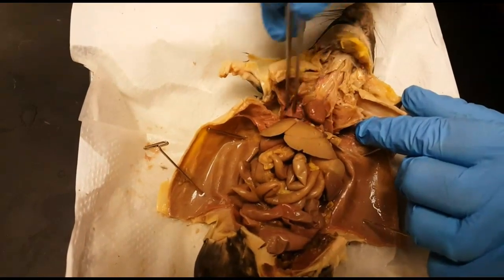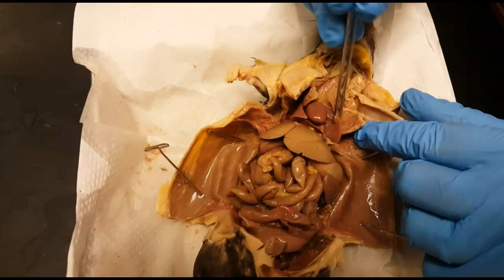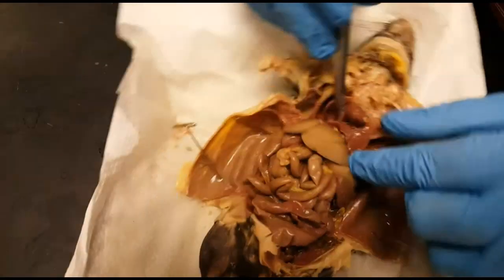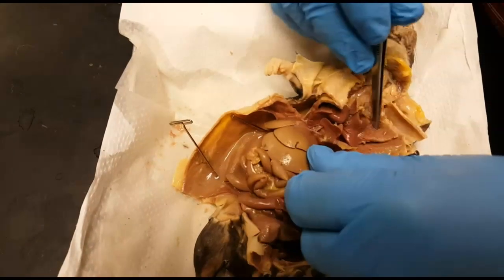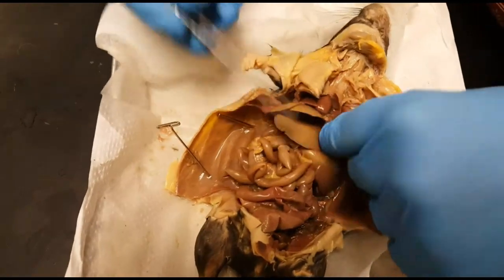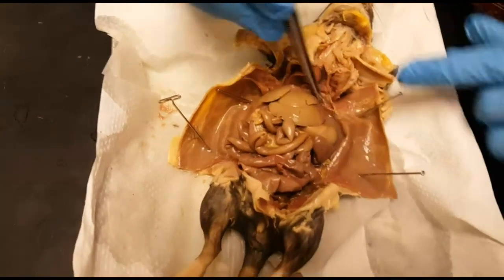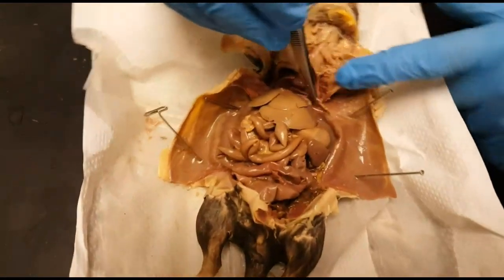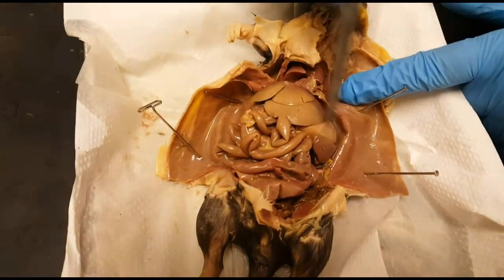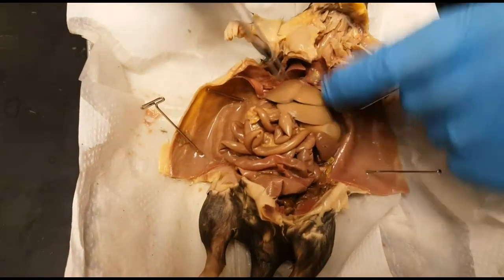The heart is right here, and the lungs are sitting on both sides of the heart — right and left lungs. Inferior to that we have a major inspiratory muscle that helps us breathe, separating the thoracic and the abdominal cavity, called the diaphragm.